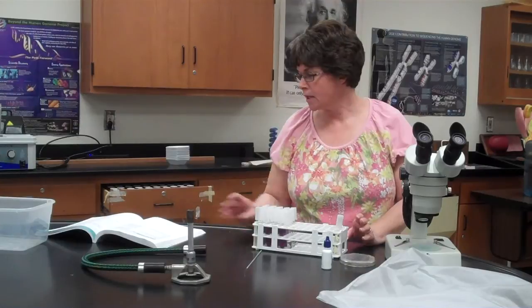Okay, here is the second lab for the fungi kingdom. This is where we're going to look at molds. One of them that you're going to look at could possibly be a yeast, but the rest of them are all going to be molds. So remember that the molds are going to be multicellular. They're going to have filaments. They're going to have spores, okay, as opposed to the yeast that were single-celled and did not have filaments. Like I said, the one that crosses kind of between the two that has pseudohyphae is your Candida albicans.